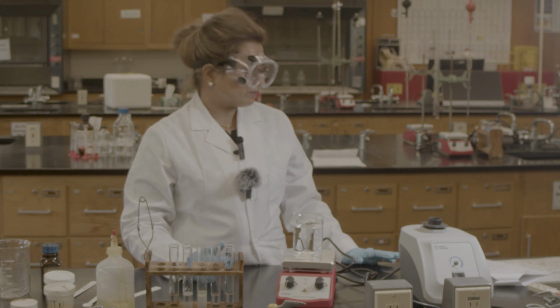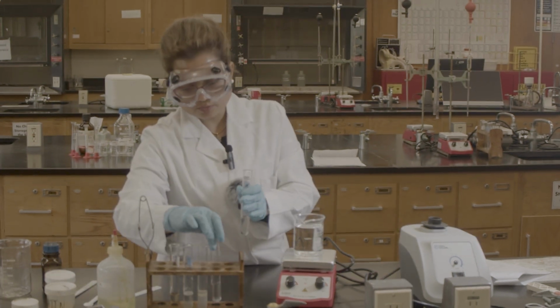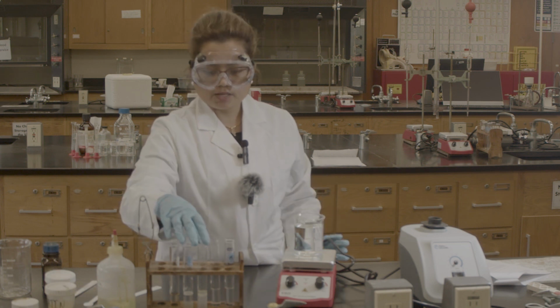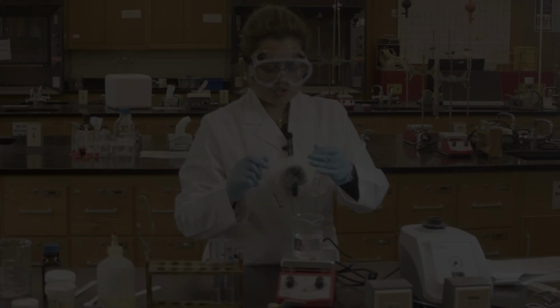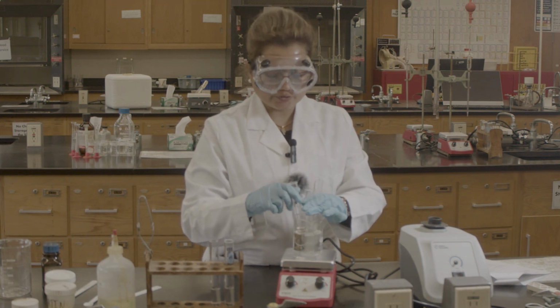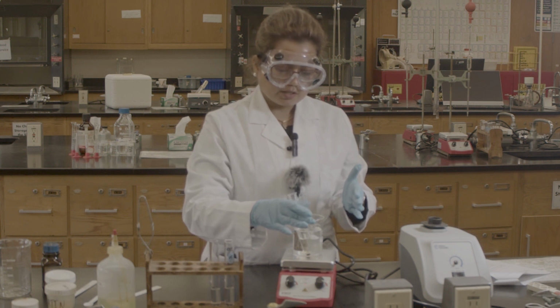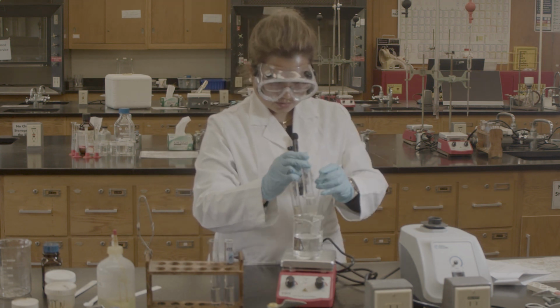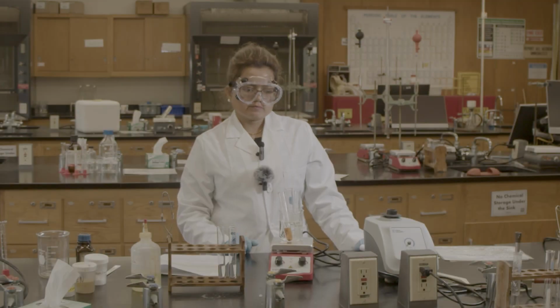So group 2, what is the purpose? We are going to see which solute is going to be soluble in the water. We can see that sodium chloride and sucrose are both soluble in cold water. So I'm not going to do the test for the hot bath for those, but I will observe these three: oil, gelatin, and iodine. I'm going to do the hot bath for only these three to check if something changes when the temperature increases, whether they are soluble or not. So I have oil, gelatin, and the iodine, and we will come back after 15 minutes.